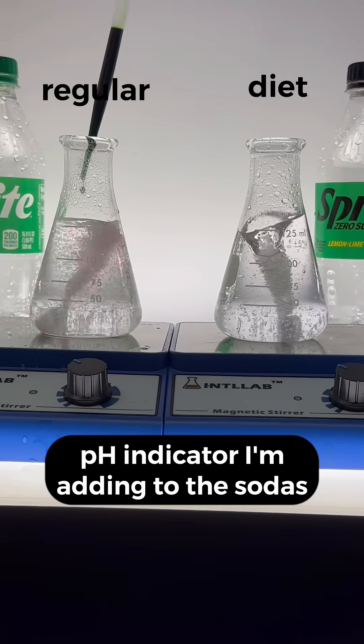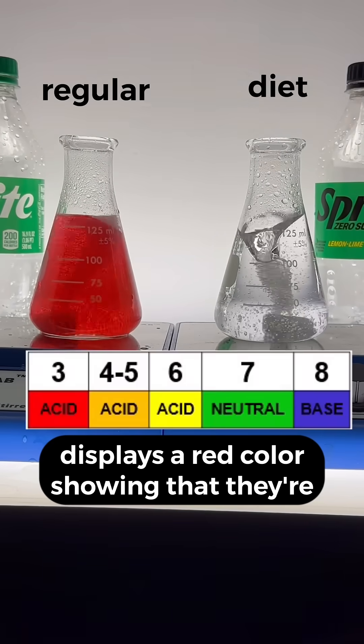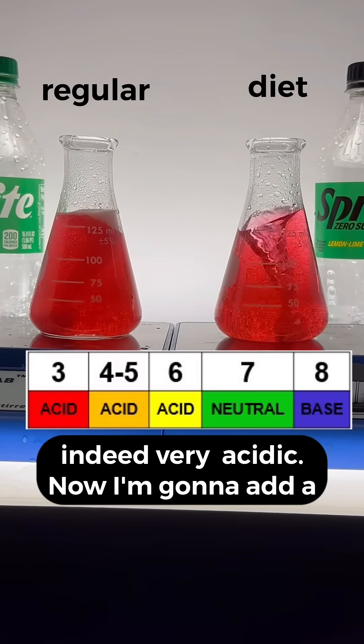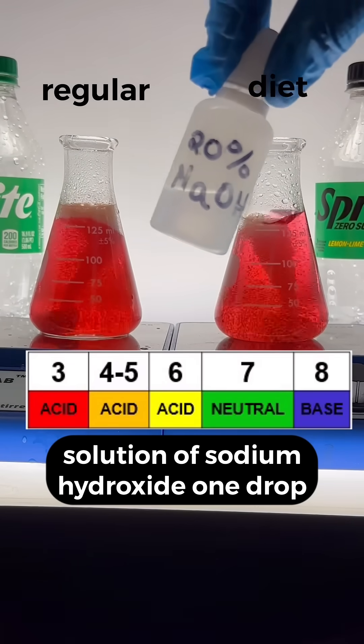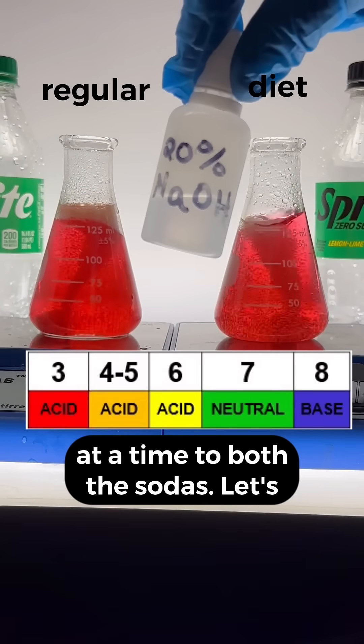The pH indicator I'm adding to these sodas displays a red color, showing that they're indeed very acidic. Now I'm going to add a solution of sodium hydroxide, one drop at a time, to both the sodas.